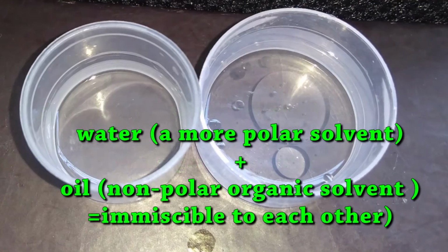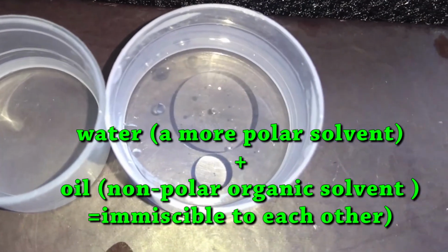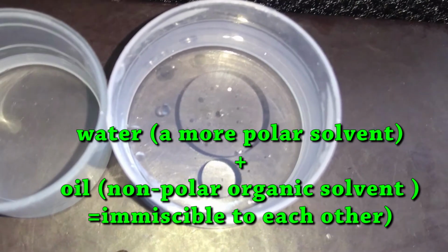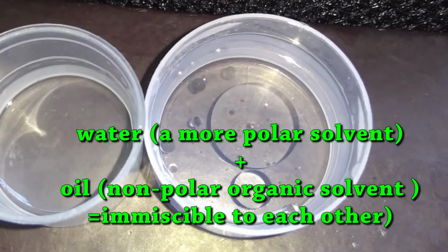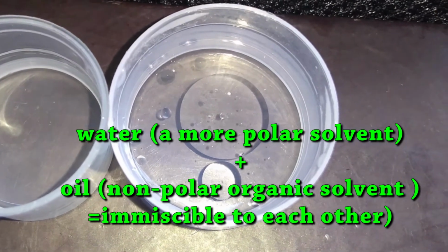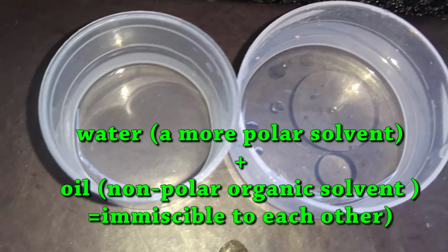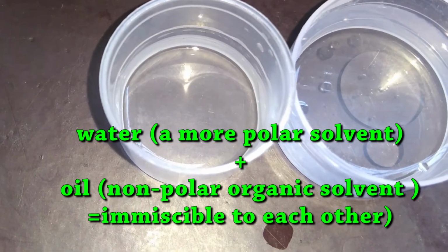But coconut oil remains insoluble in the polar solvent water. So what we can conclude is that a non-polar substance is soluble in a non-polar or less polar covalent solvent, but insoluble in a highly polar solvent.